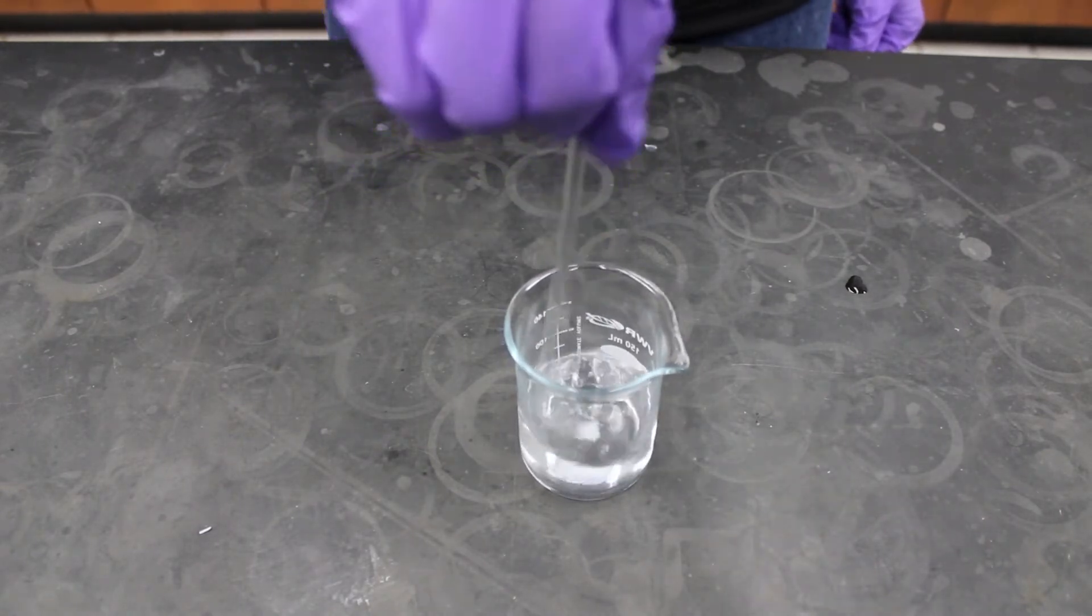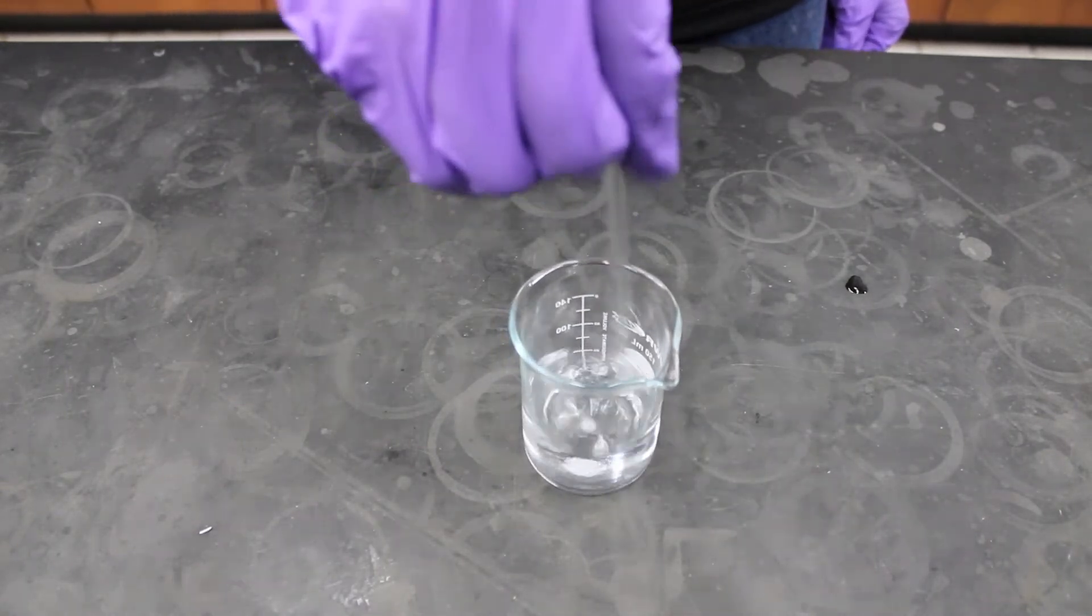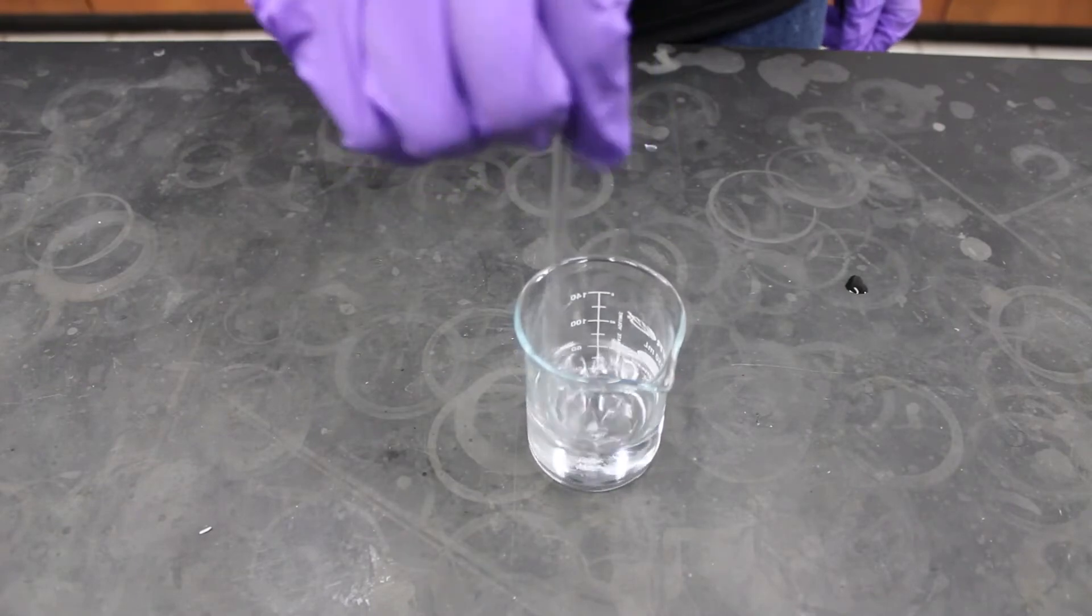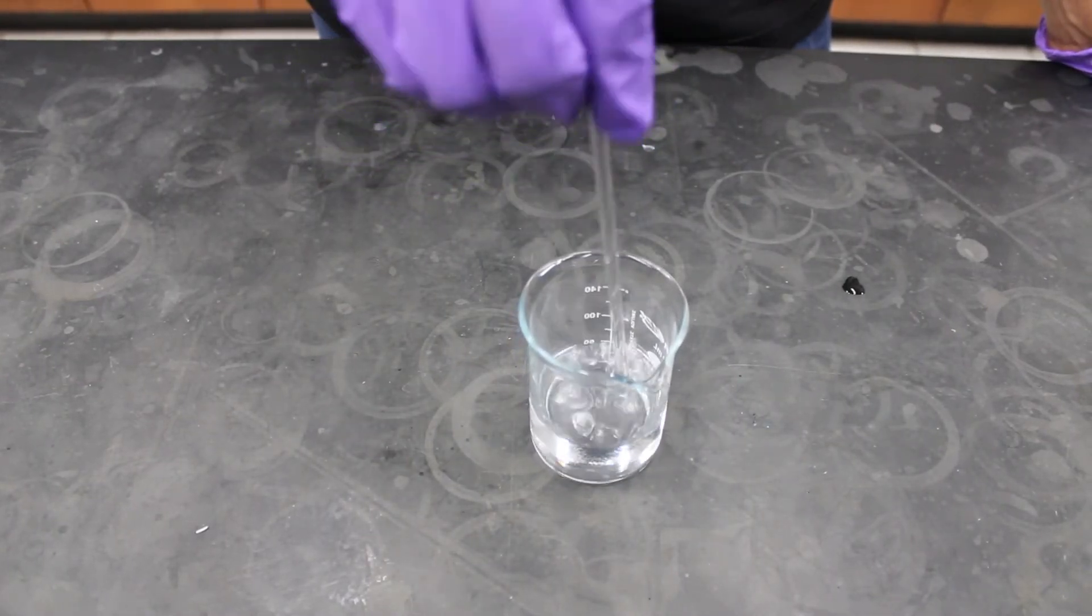This will take a few minutes, so be patient and continue stirring with your glass rod. Do not remove your glass rod from the beaker once you put it in.